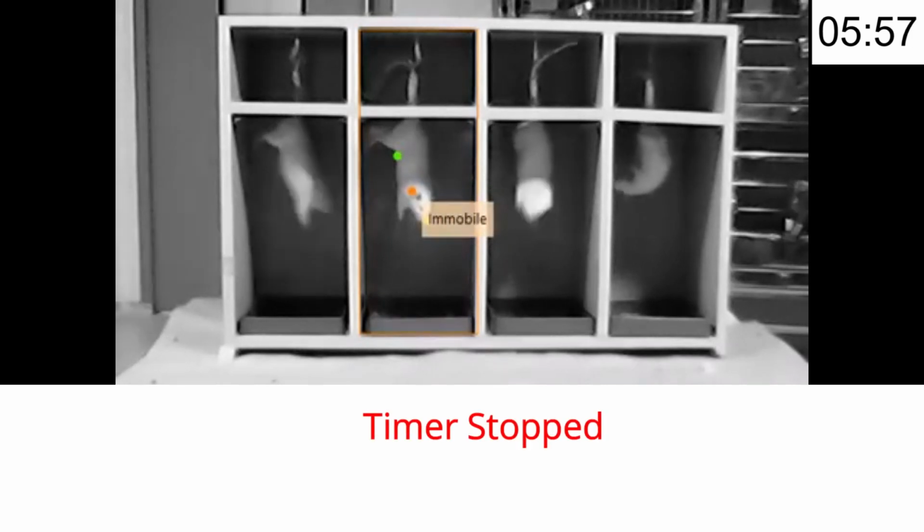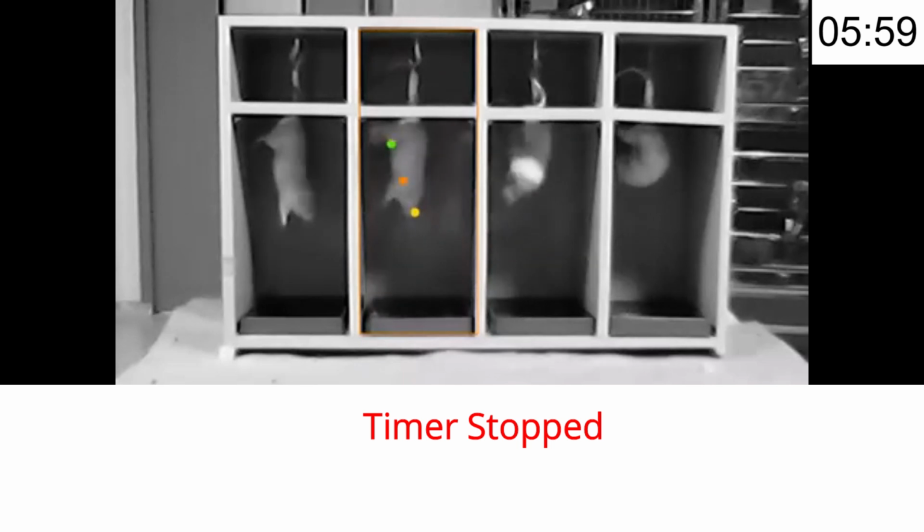And one more point I want to make: how to attach the tape to the animals. I already have a procedure for that, because it is very difficult when you attach the animals to the hook. It is not stable. Sometimes it detaches during the experiment. So you need a perfect solution. For that I have a solution.